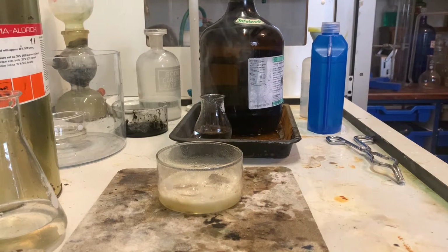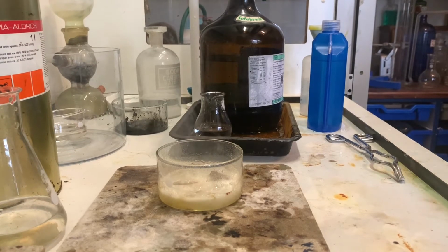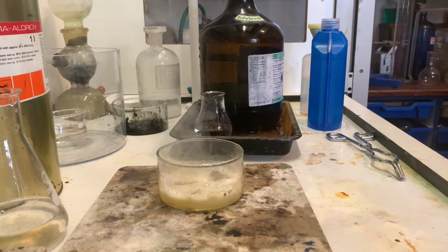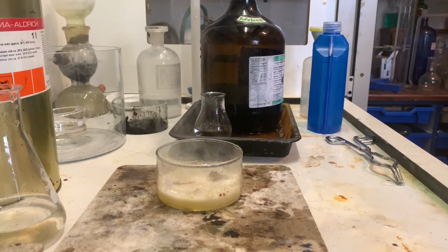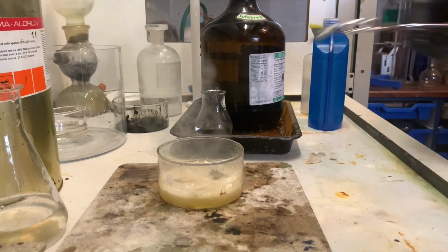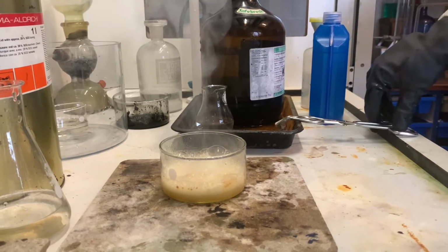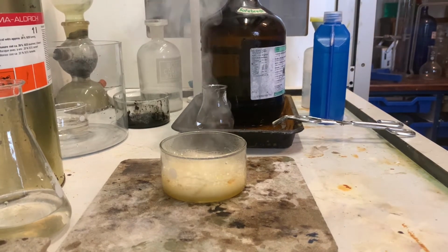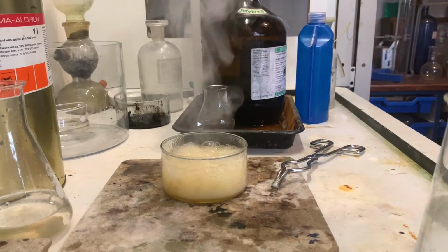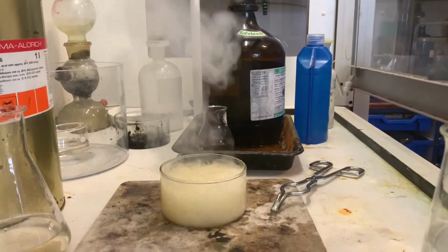And if you put your memory back to Walter White and Jesse Pinkman, they'd be much better using concentrated sulfuric acid to dispose of their bodies instead of hydrofluoric acid. Hydrofluoric acid is an incredibly toxic acid, but it's not a very strong acid because it doesn't protonate very well in water. As you can see there, sulfuric acid does, and it has such an affinity for water, it's going to start very quickly carbonizing and literally cooking this chicken. By the time it's finished, it'll be well overdone. I'm just going to put the fume hood down because there's a very vigorous reaction there.